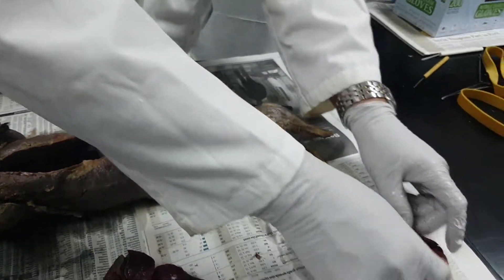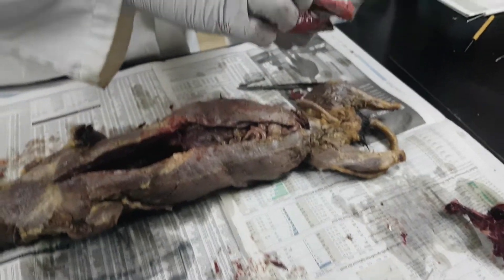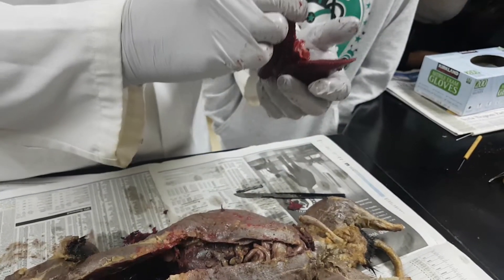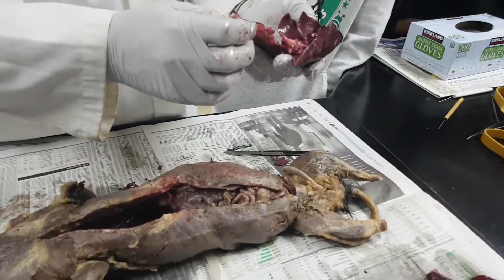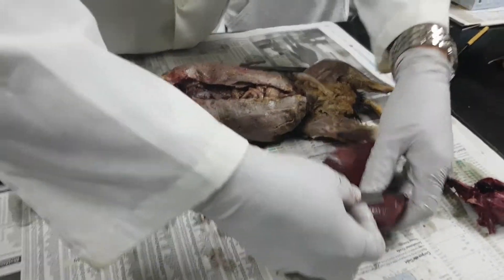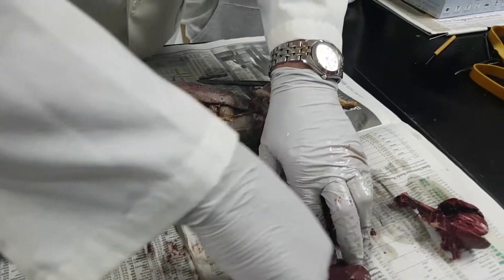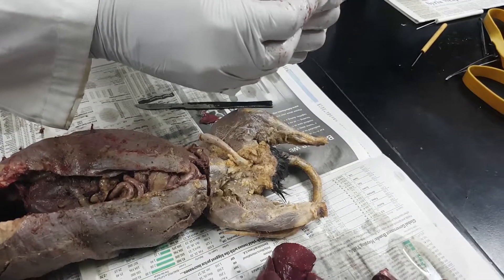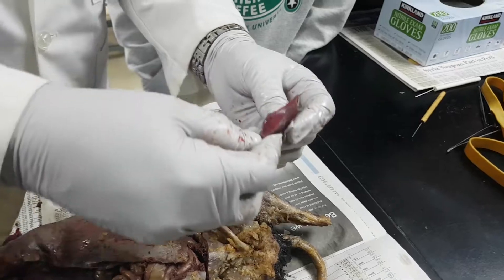There's the heart, and you can see the lungs. If I hadn't cut this right here, I could have left it open, put a straw in there, and blown on it — the lungs would expand and contract. That's kind of cool. Let me cut one of the lungs open. You see there's not a hole, but if I squeeze you can see a lot of water coming out. So that's the lungs.